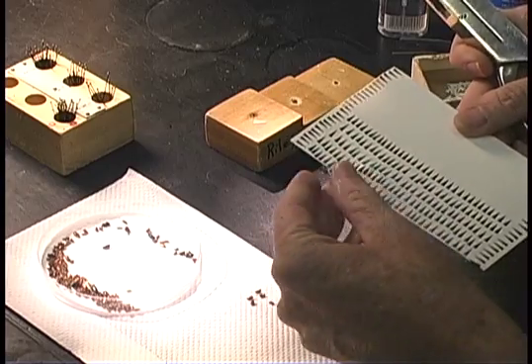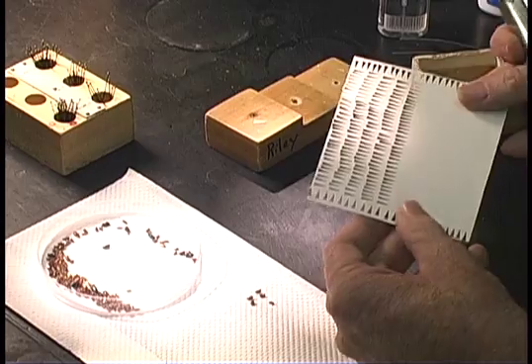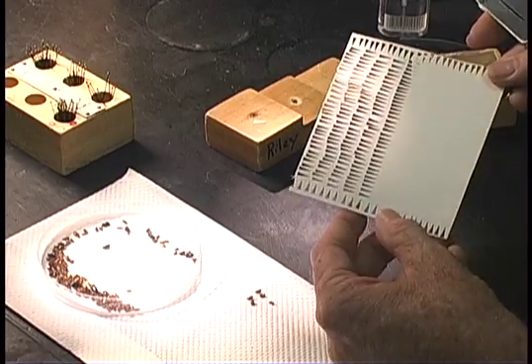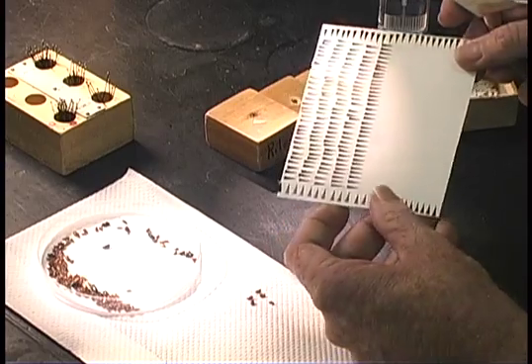Point mounting insects is a very important preparation technique. Since most insects are small, understanding point mounting and doing a good job at it is very important.